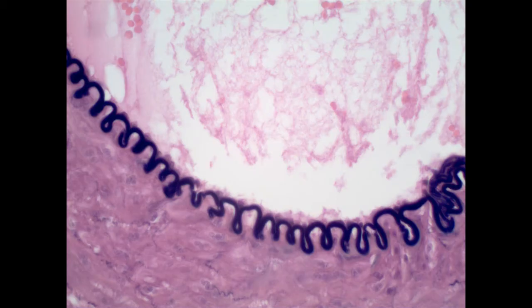If we go through these in the order that you find in your lab manual, the first example we have is the simple squamous ET. And the name here, we'll see, is meaningful. The word simple at the beginning is indicating a single layer of cells, whereas the second part, squamous, is describing the shape of the cells. And that term squamous is describing a very flat or sheet-like cell.